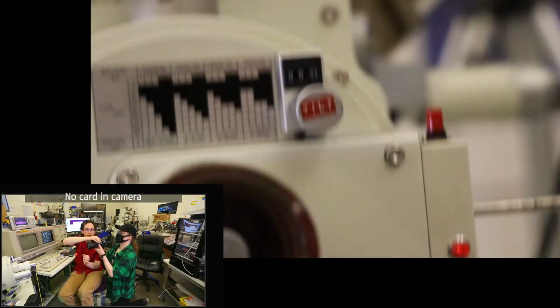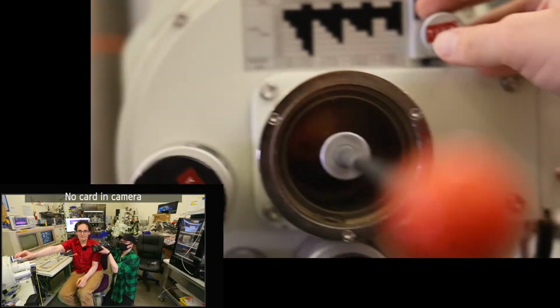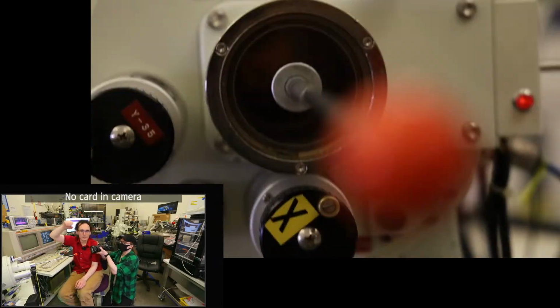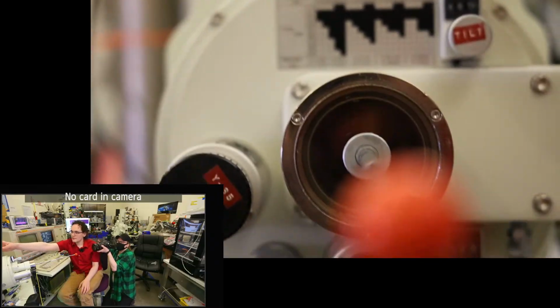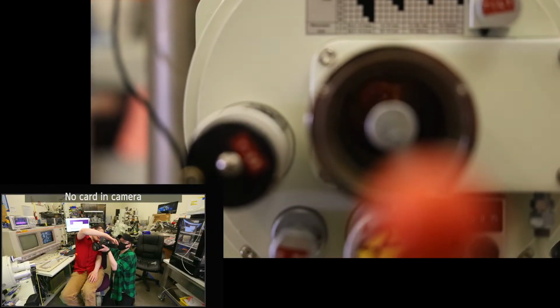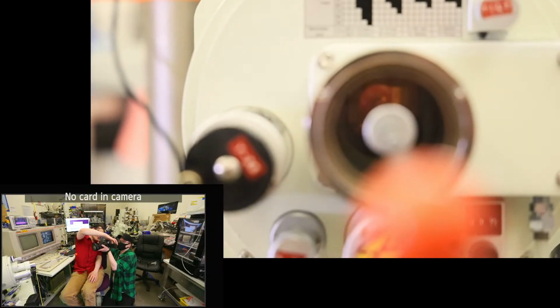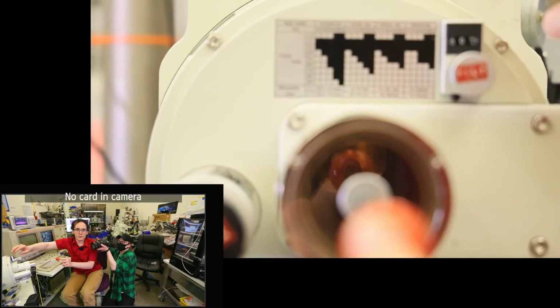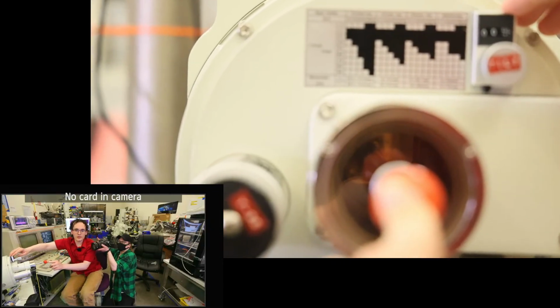There we go. Here, do you want to come past the end of the sample rod, maybe? And then try and do some focus. So we're going to be bringing our stage down. And then we can also increase the exposure by doing that, and that tries to auto expose higher. So we see all the way back in there. So we're pushing our sample exchange rod all the way back.